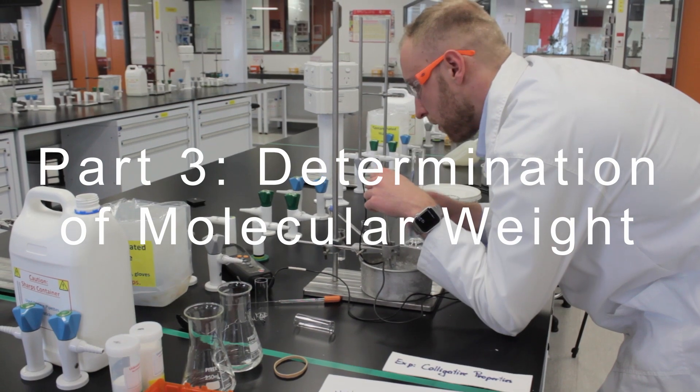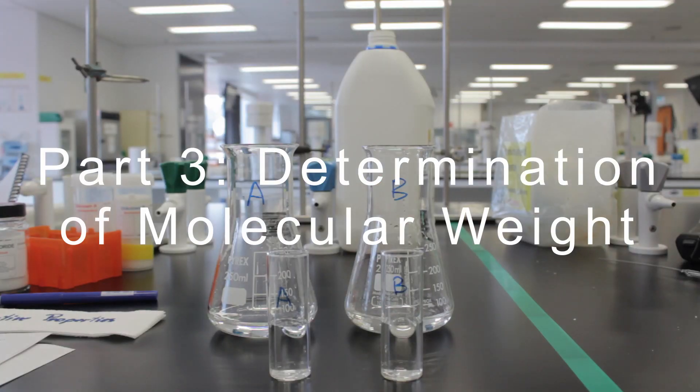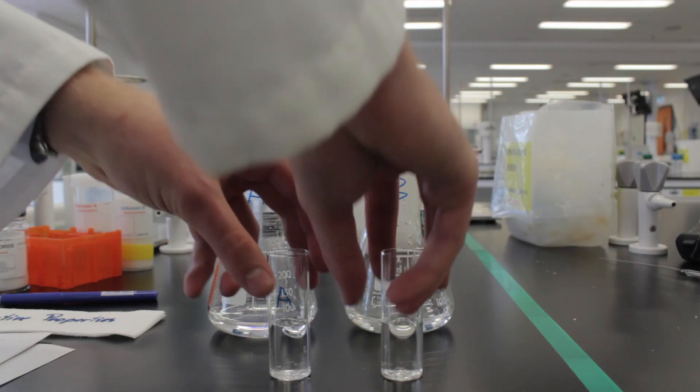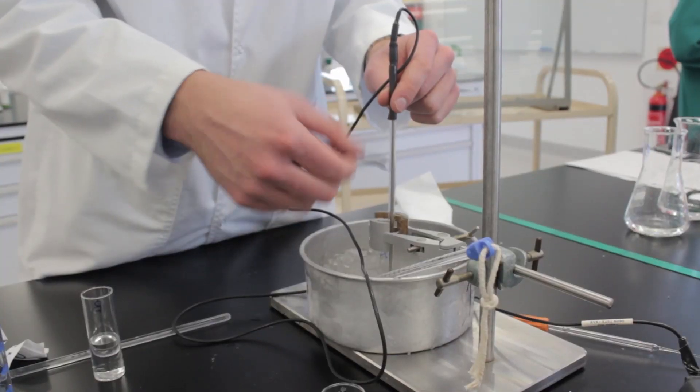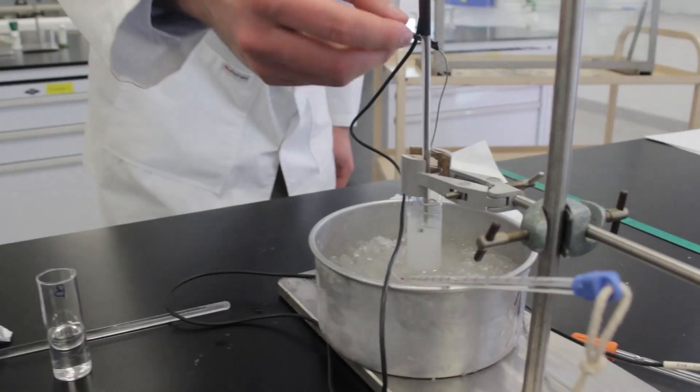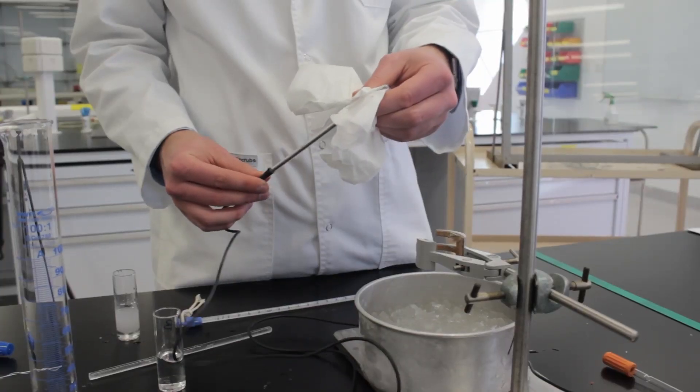Now we can use this technique to analyze the unknown solutions we made at the start. Transfer these solutions into test tubes and repeat the freezing point measurement process. Make sure you clean the thermometer and wire thingy between measurements.